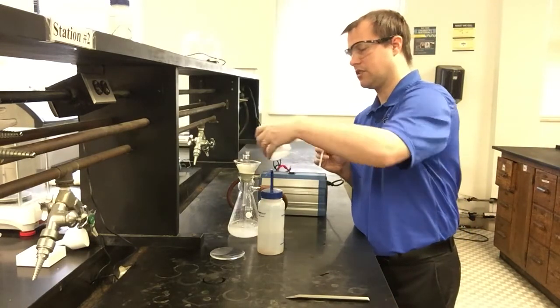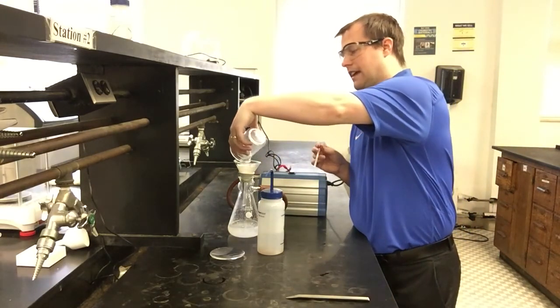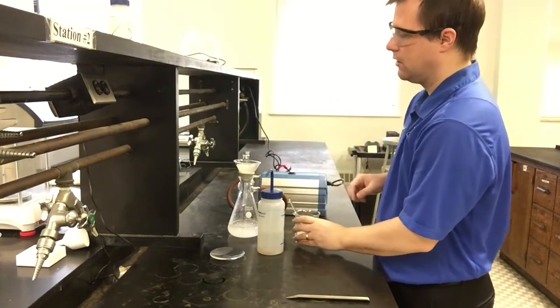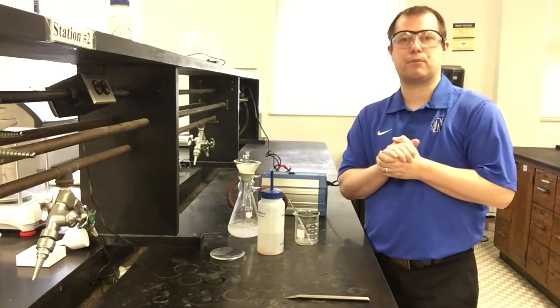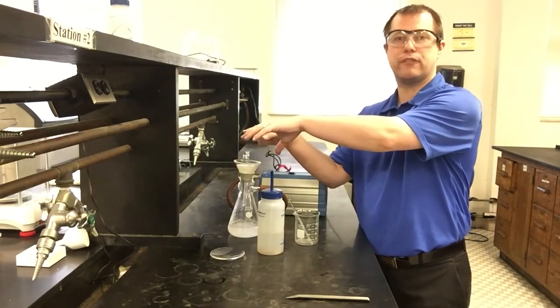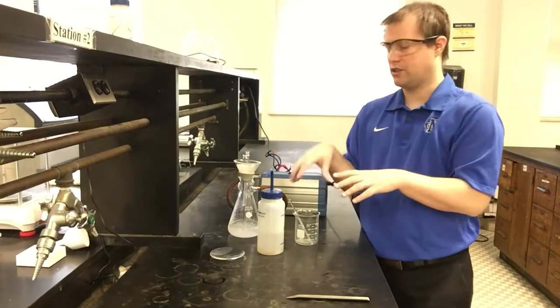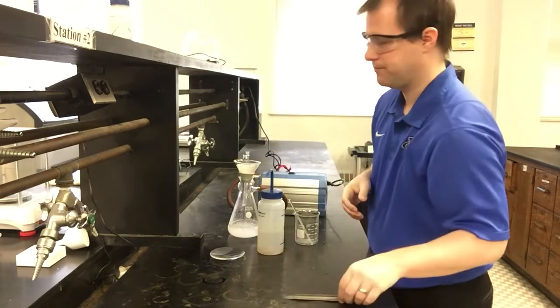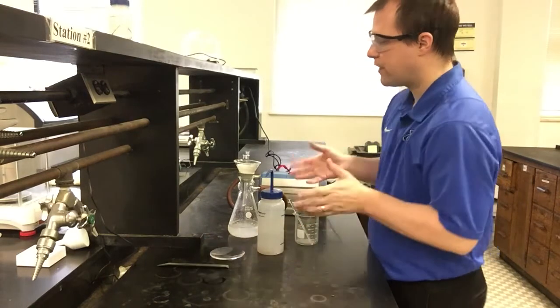I'm going to stir it well so I get all of it, hopefully. Add that. I'm going to let that go down a little bit more. It's up pretty close to the top of the filter paper right now. And then I'll do what I described, holding this here above my filter paper while squirting it with the water, trying to get all the last contents out and into my filtration setup. So we're very, very close to being done.